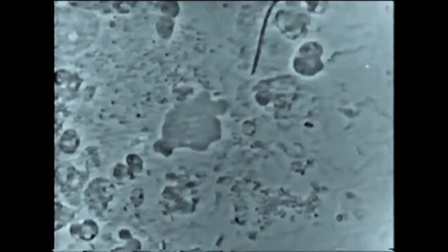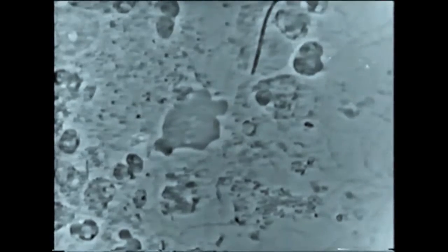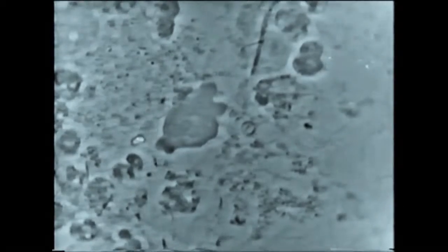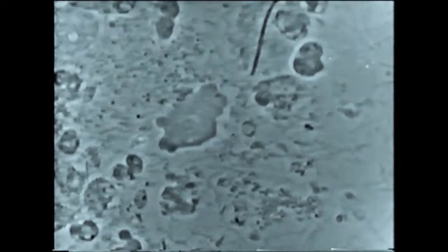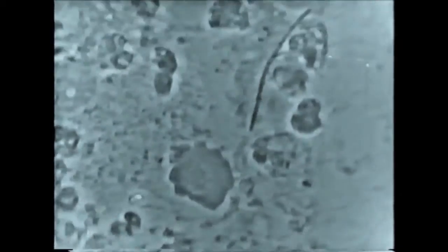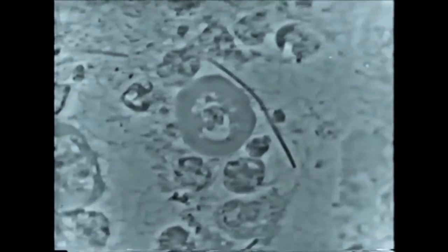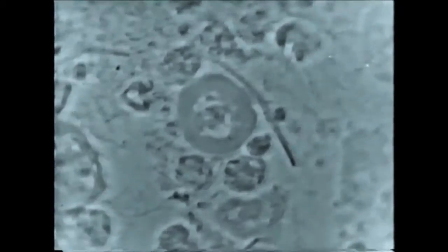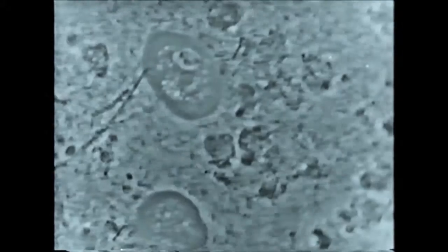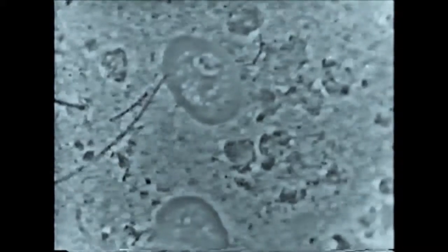You can see the amoeba moving up slowly with the pseudopods. We clearly see the uroid on the lower portion of the amoeba, and we can see a little hollow in the center. Now we see some more parasites here — one dead, two rounded parasites. Again, two parasites: one on the lower part, one on the upper portion.